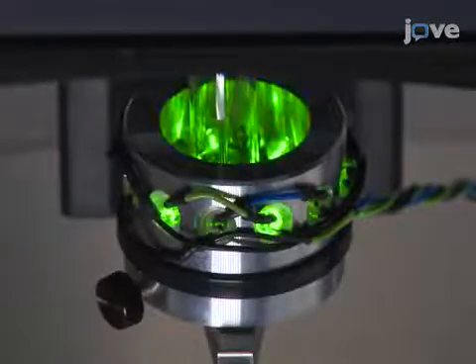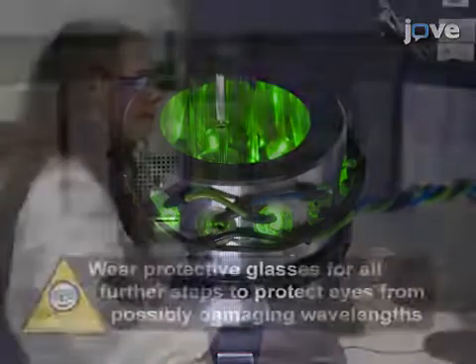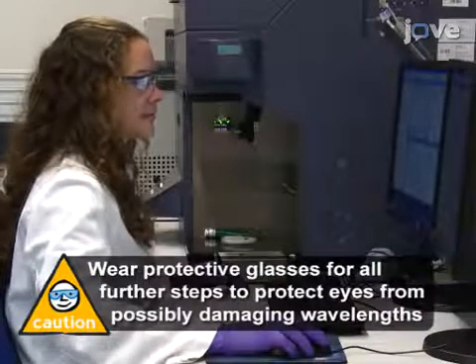The most critical step of the procedure is handling of the glass tubes. Glass FACS tubes are very fragile, and hence it is recommended to practice the insertion of the glass tubes into the cytometer prior to doing experiments. Then, switch on the 500 nanometer LED light on the outside of the tube and continue measuring the fluorescence intensity of DRONPA.